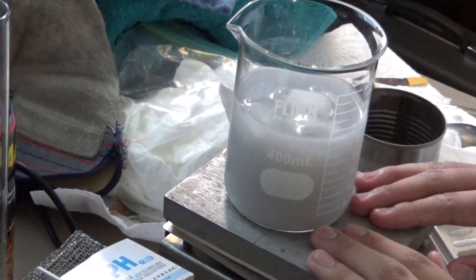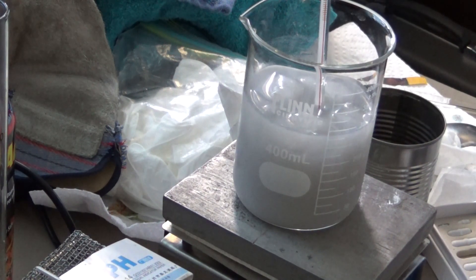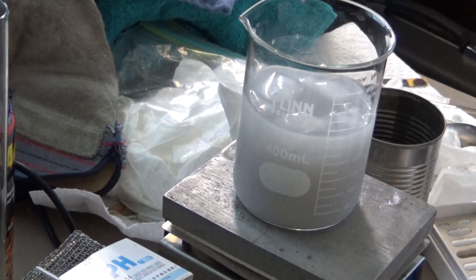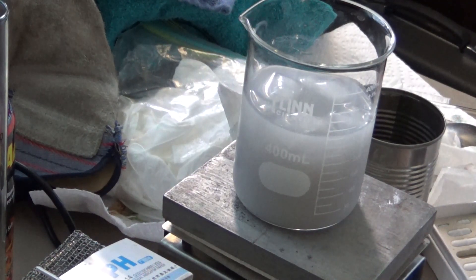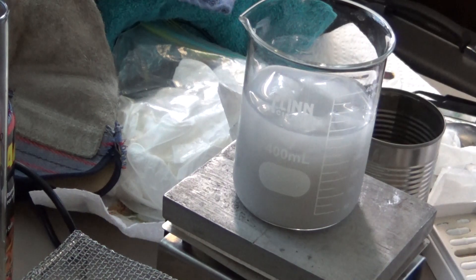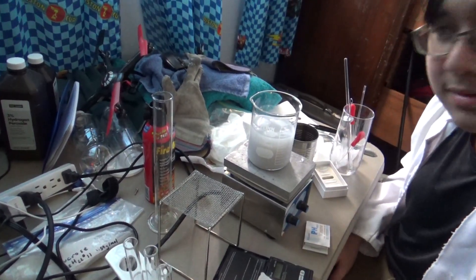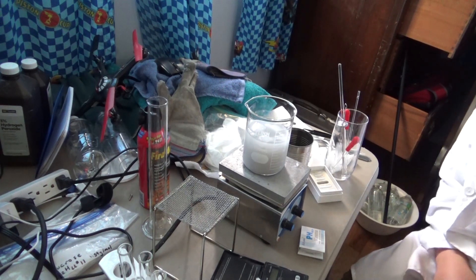This has been stirring for roughly five minutes probably. It's pretty cold to the touch — around two degrees centigrade. I'll take the pH. The solution is alkaline — pH of 12 to 13, very alkaline, which we are expecting. Now I want to do a manganese dioxide test: I'll put a little bit of the solution into a test tube with manganese dioxide. If it decomposes, we should have hydrogen peroxide. If it doesn't decompose, we either haven't made any hydrogen peroxide, or it's not concentrated enough. If it doesn't react at all I'll be surprised, but it could happen — if so I'll just add more of this sodium peroxide aggregate and increase the concentration.